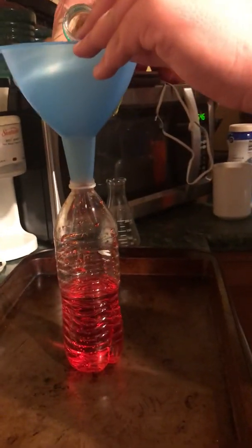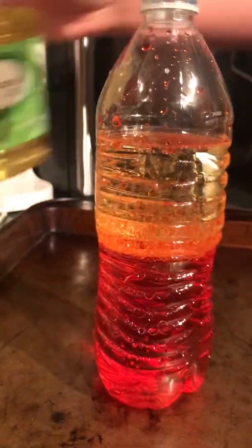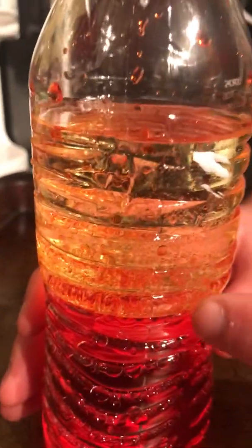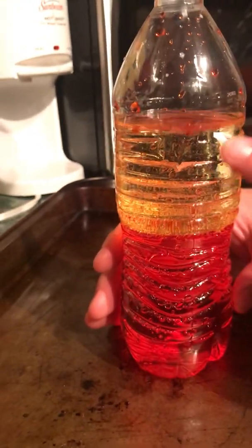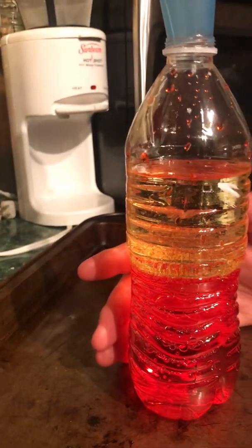So I'm going to pour some oil in there. And you see it's mixing up as I pour. But once that settles down and sits for a minute, you see a clear distinction right here. And you can still see some mixture, but most of the oil has moved up here. And that's partly because water is denser than oil. But you can see there's some bits of water and oil that are still mixed together.